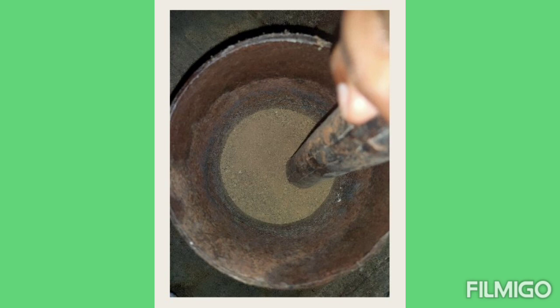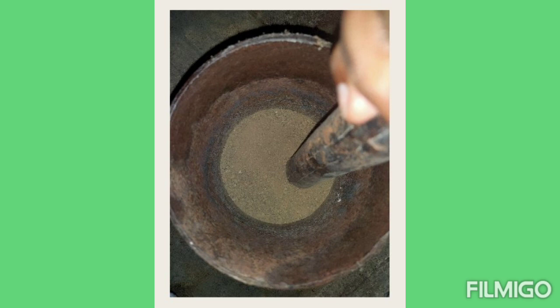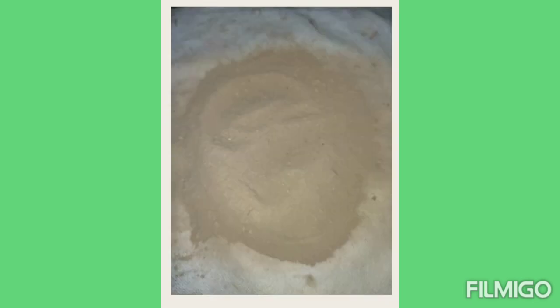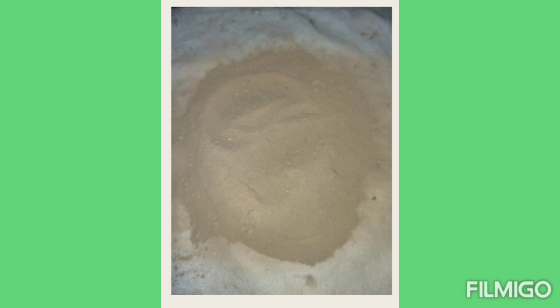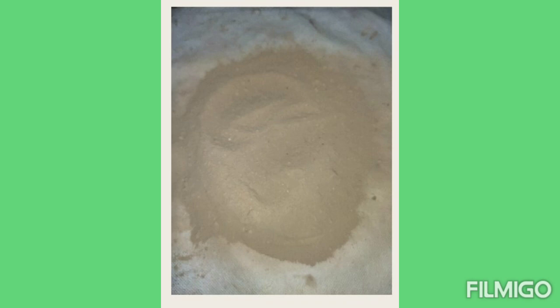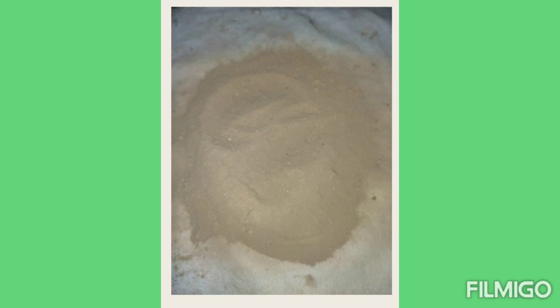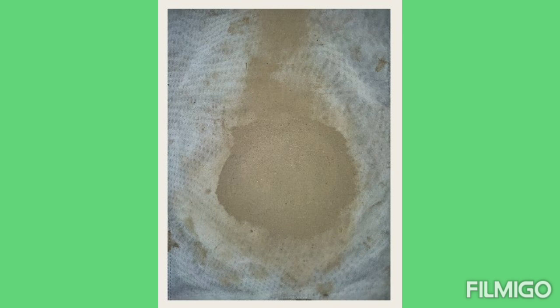See the video — after complete drying of the soil, we crush it and make it into powdery form. Just see the image; it will become completely powdery in nature. As you can see, this soil has been made powdery.